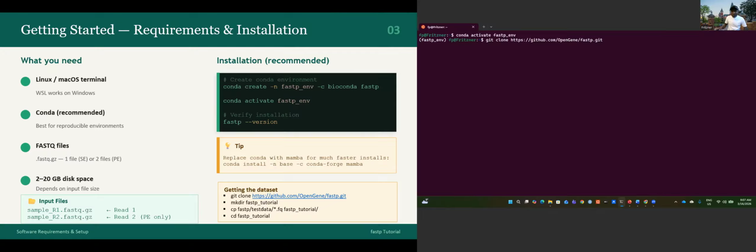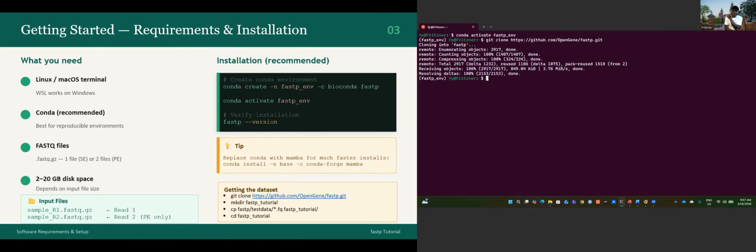github.com/openGene/fastp.git. I hope I didn't mistype anything. Okay, now it's cloning. I didn't mistype. That's good. So we have the repository cloned. The last part, fastp.git, means the fastp folder is created in the home directory, where I am now. That means in the home directory, I should have this folder.